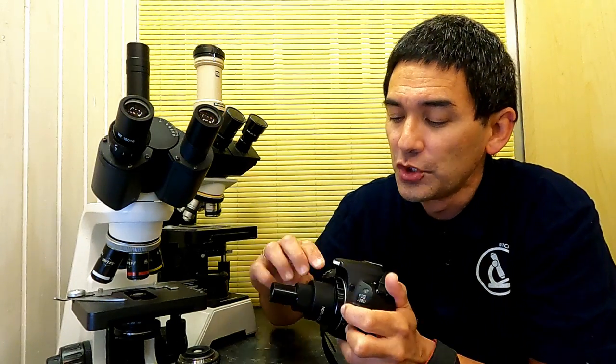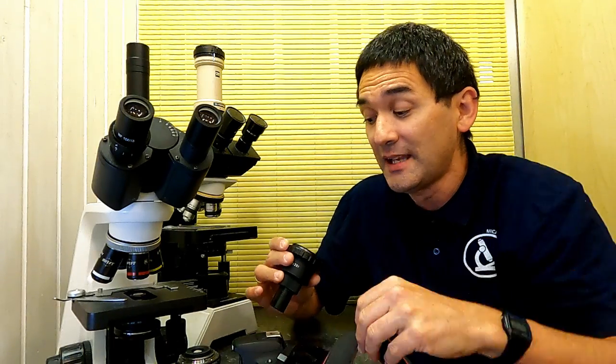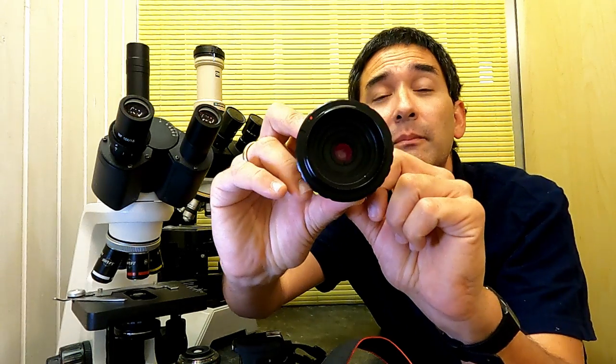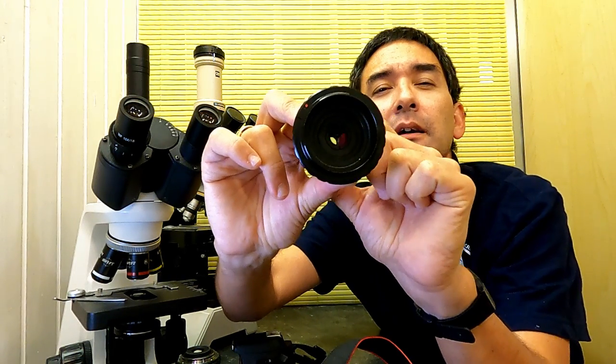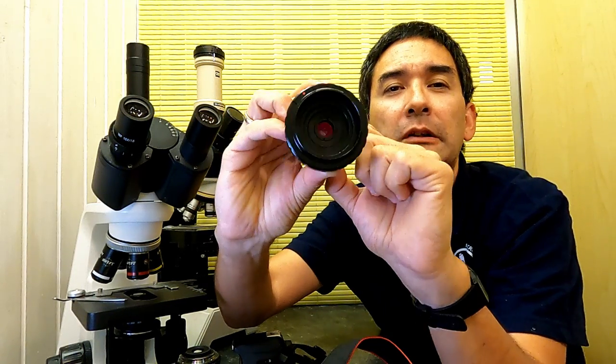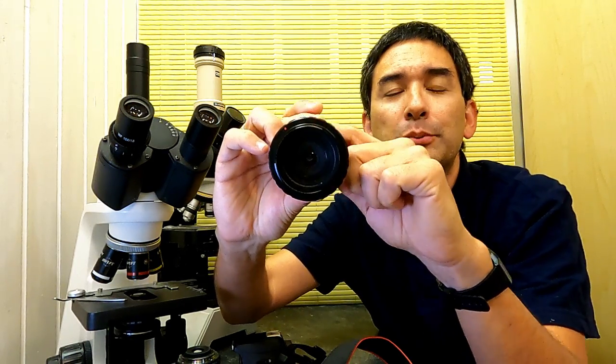However, there are a couple of issues with this adapter. But first, the thing that caused me to buy it, because it has some interesting features that I've not seen in other adapters. I don't know if you're able to see this, but if you turn this here, there is a little diaphragm in there. By turning this here, you're able to open and close it. And when I saw this on the product page, I said, wow, finally they got it. Because you should be able to close this diaphragm so that light which reflects on the side is blocked off, and then you increase the contrast.